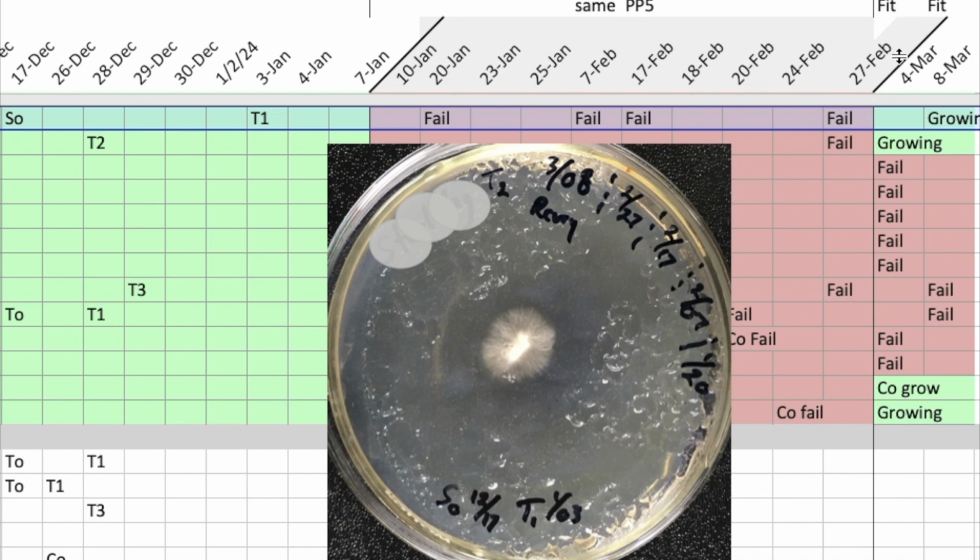And then at the beginning of March, I was suspecting the agar itself, and I got a new batch of different agar material and created another group of petri dishes, of which this photo is one of them. And on the transfer on the 8th, this same piece of agar that had been transferred through all these different non-growth plates started growing again.